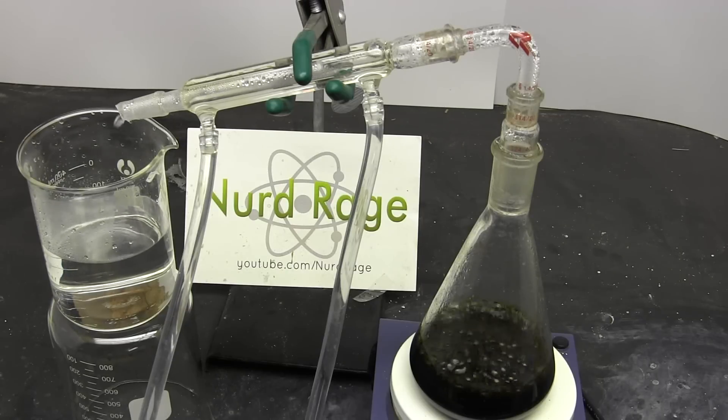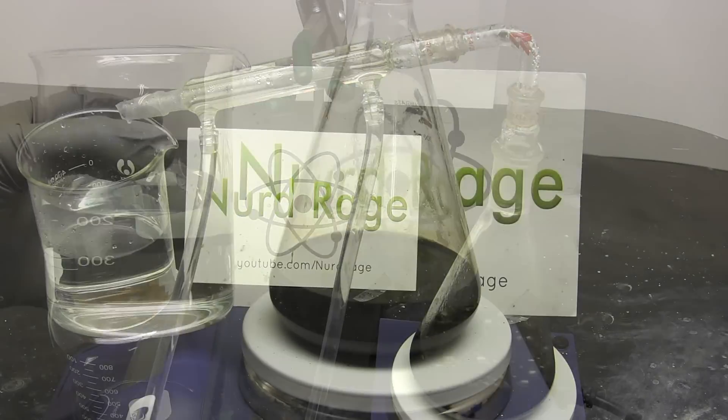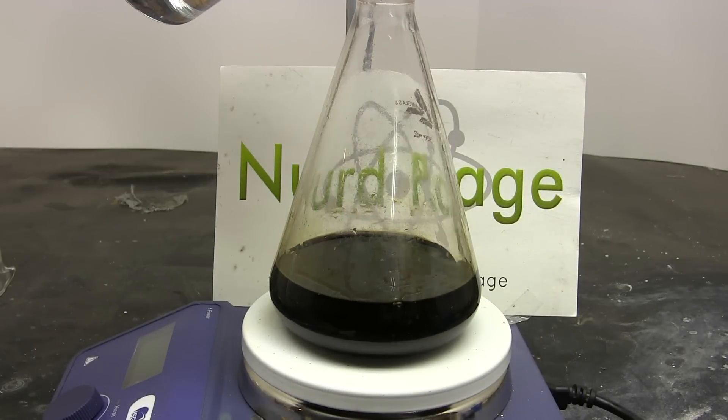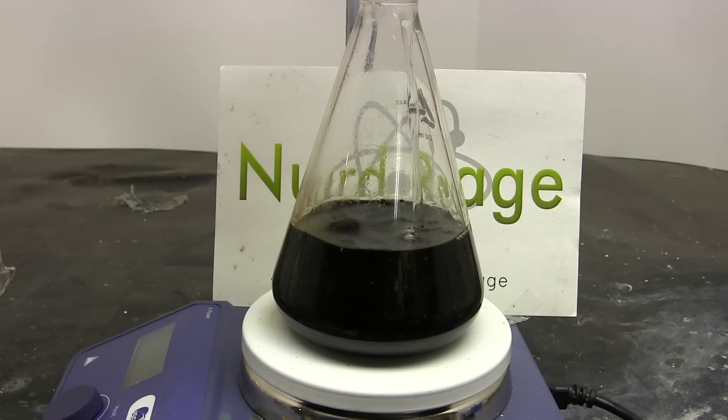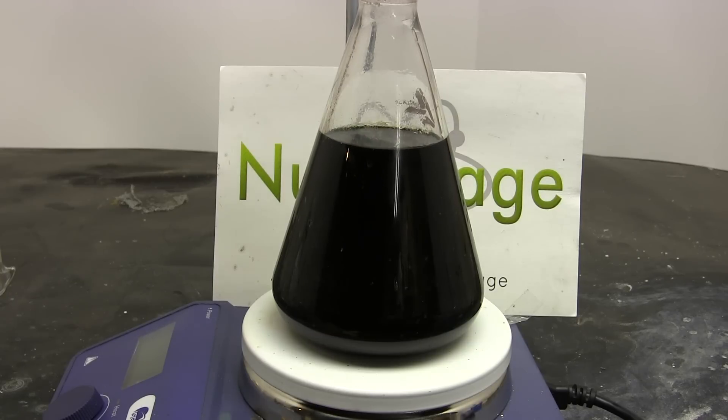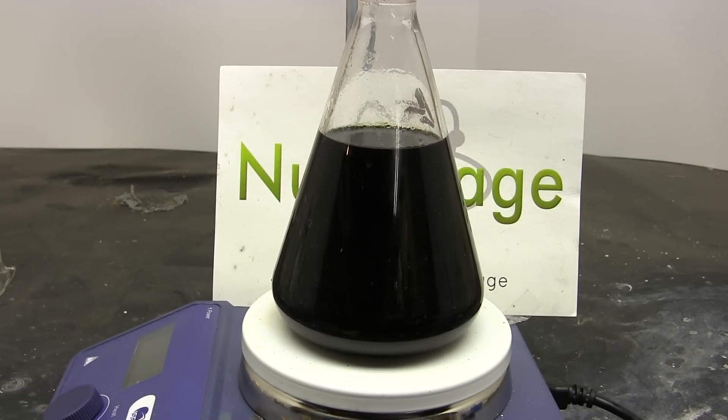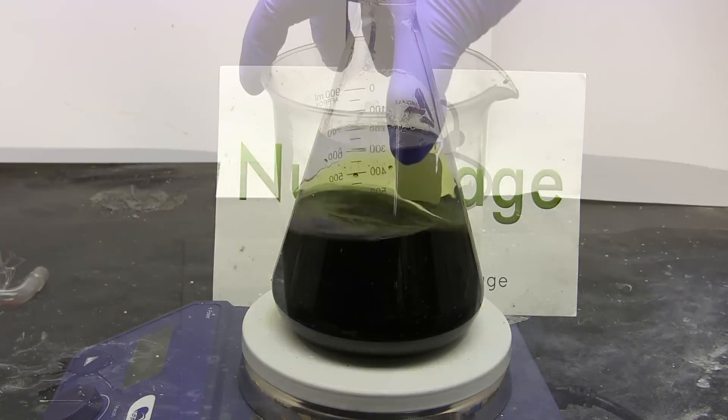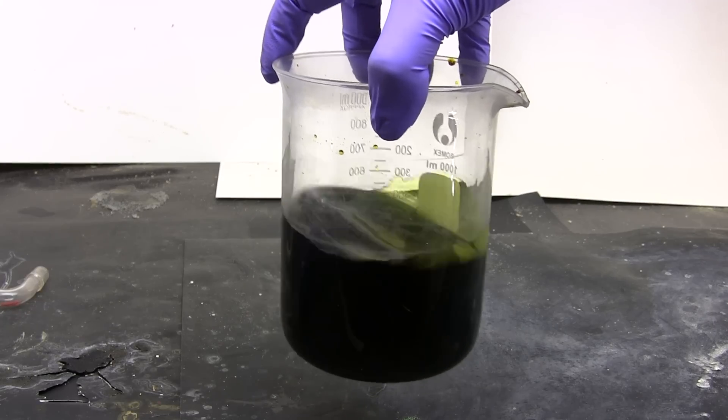Anyway once you have boiled off the appropriate amount of water, let it cool and add the hydrochloric acid back in. Now this solution contains mostly iron 2 chlorides as well as hydrochloric acid. To convert to iron 3 chloride or ferric chloride, get an aquarium pump and bubble air through it until it becomes the characteristic dark yellow of ferric chloride.